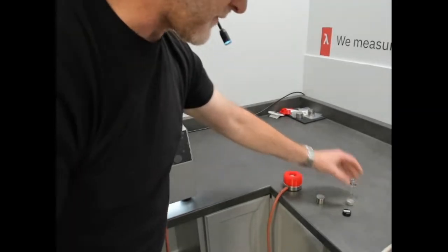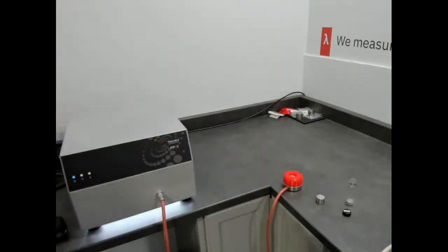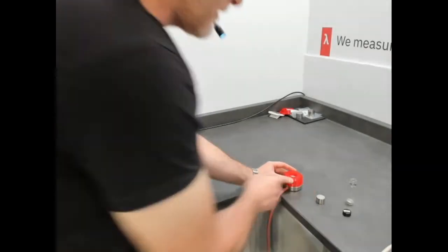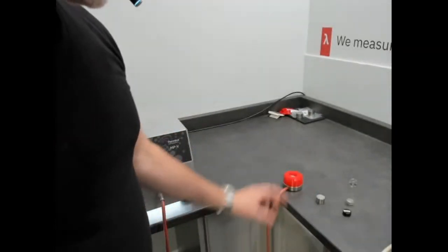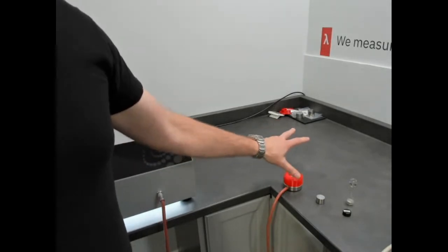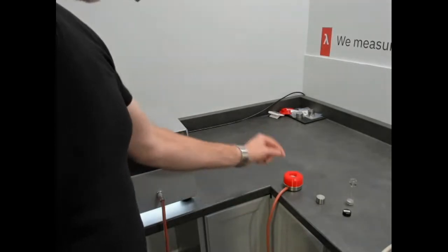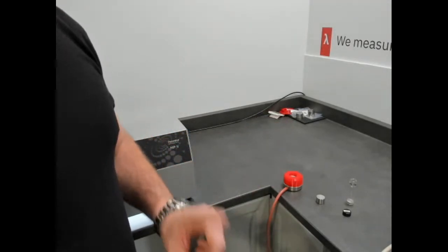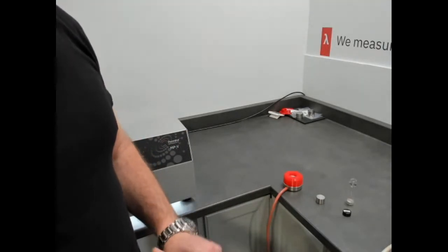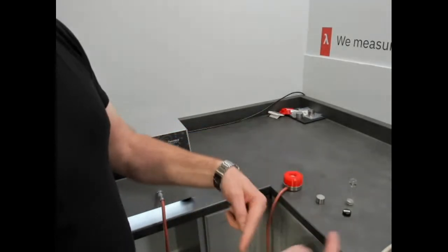Again, I'll fill it roughly half. When you're on a material like this that's spherical, with similar particle size, if I were to tap or vibrate it, you're not changing the result a lot because its density is relatively stable. But if you have a material that's low density, with different particle sizes or shapes, you have to take care that whatever you do in your setup, any future measurements you do are identical.